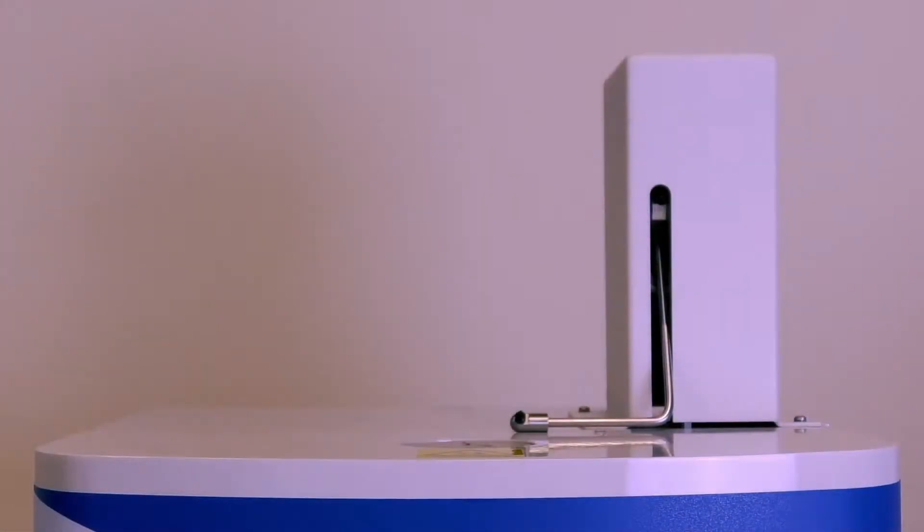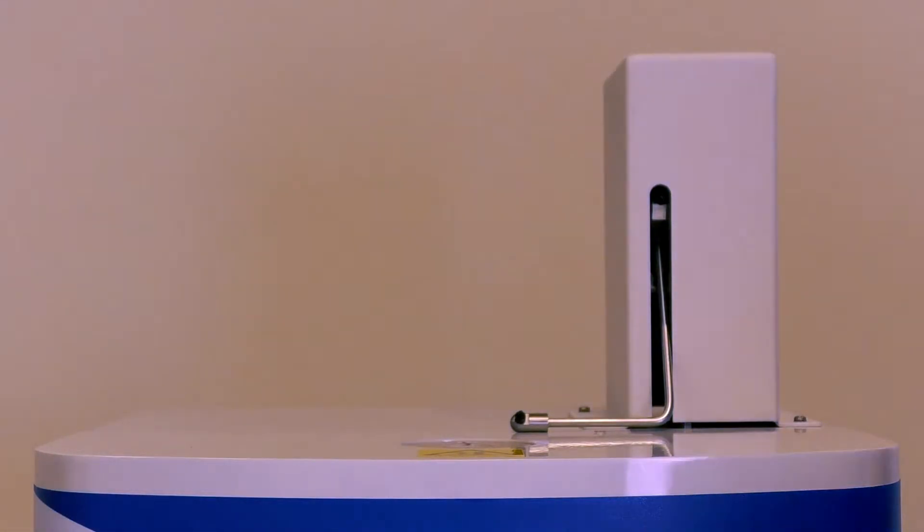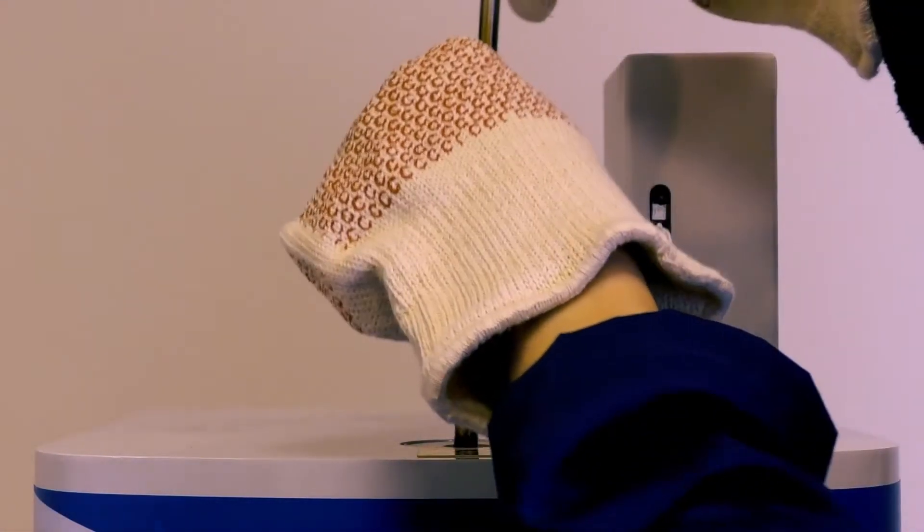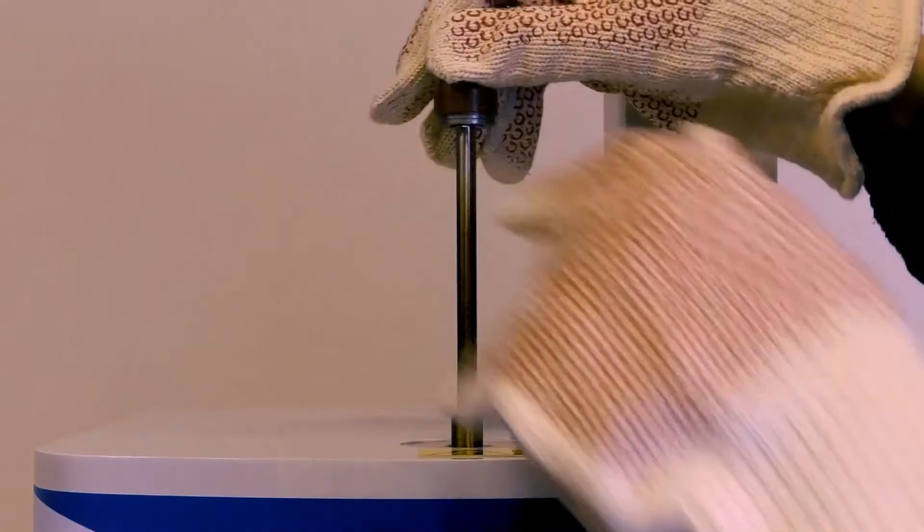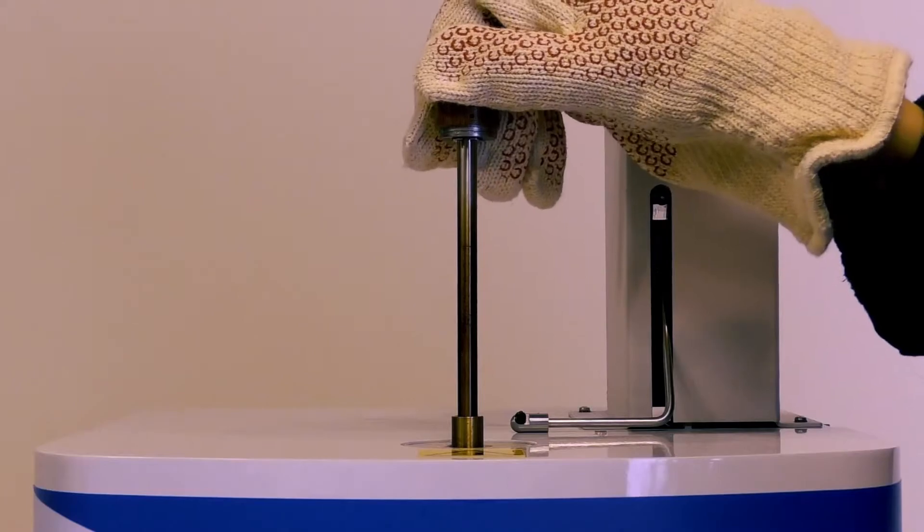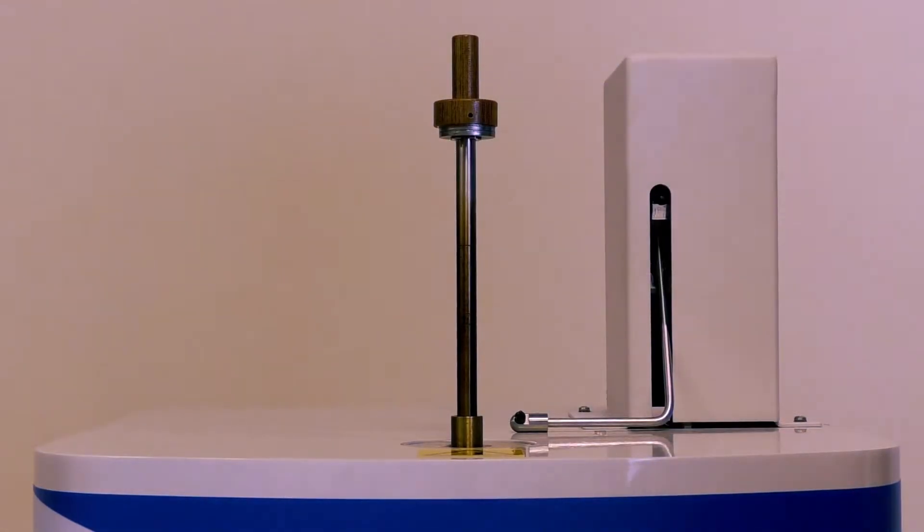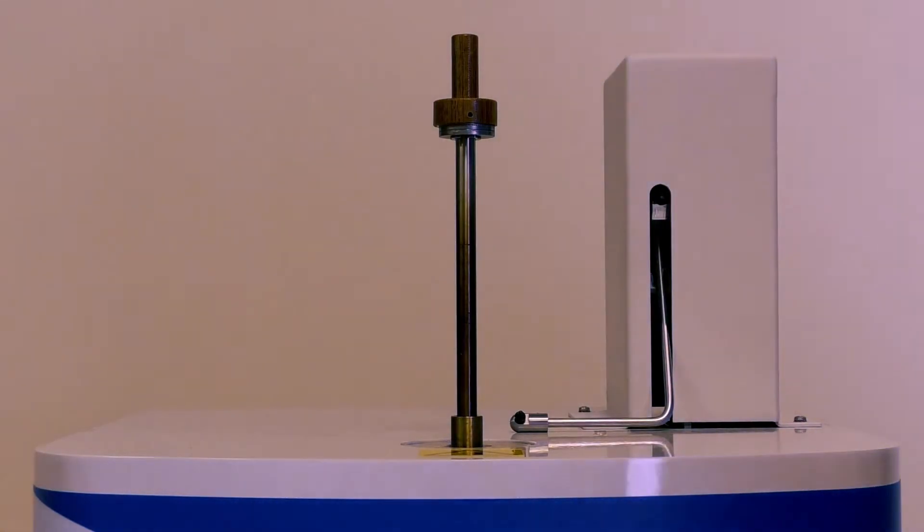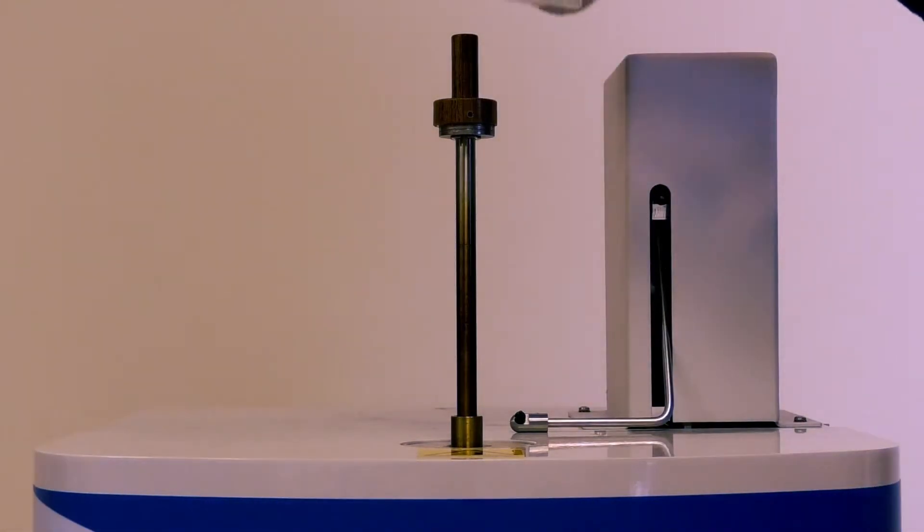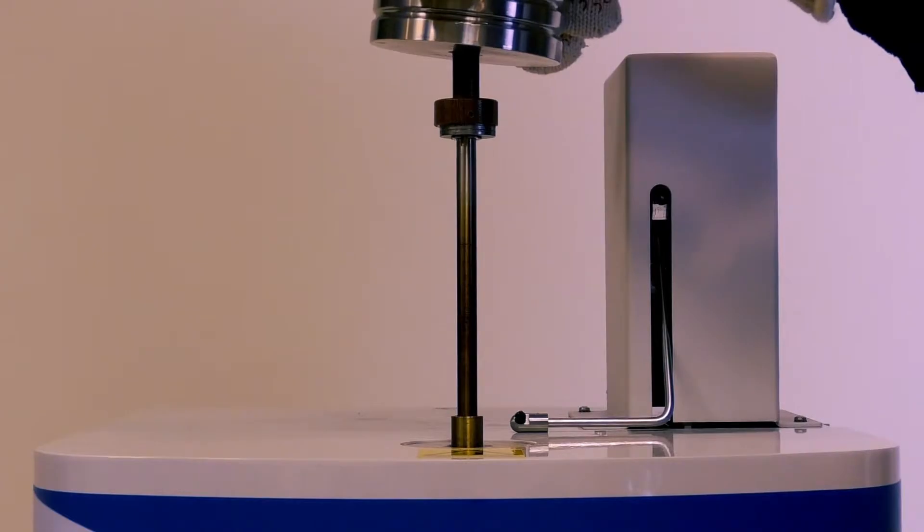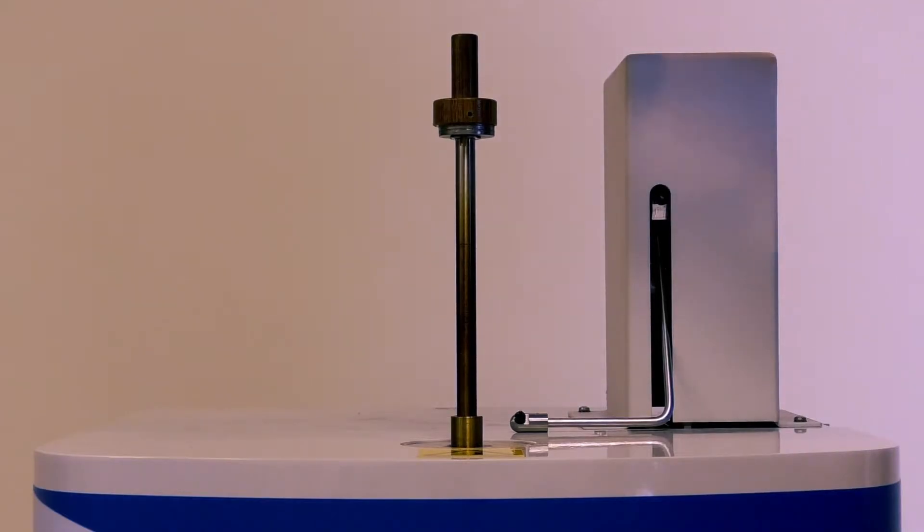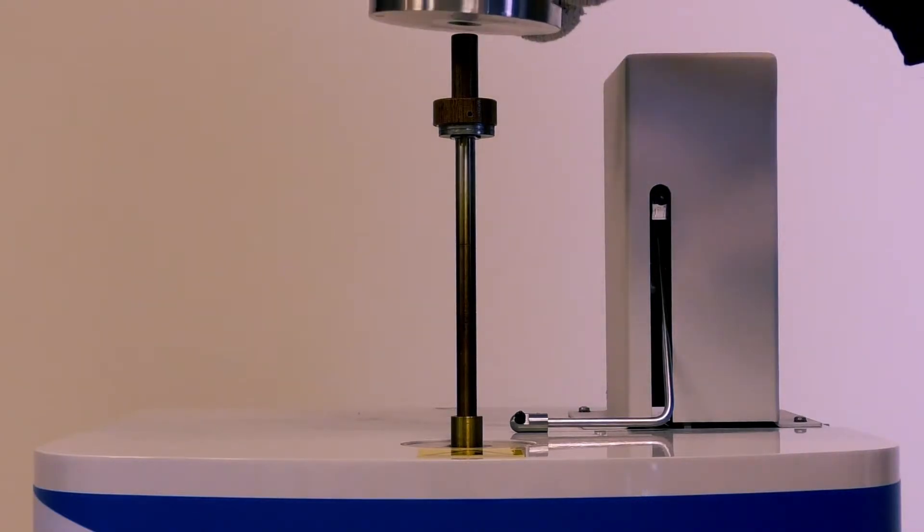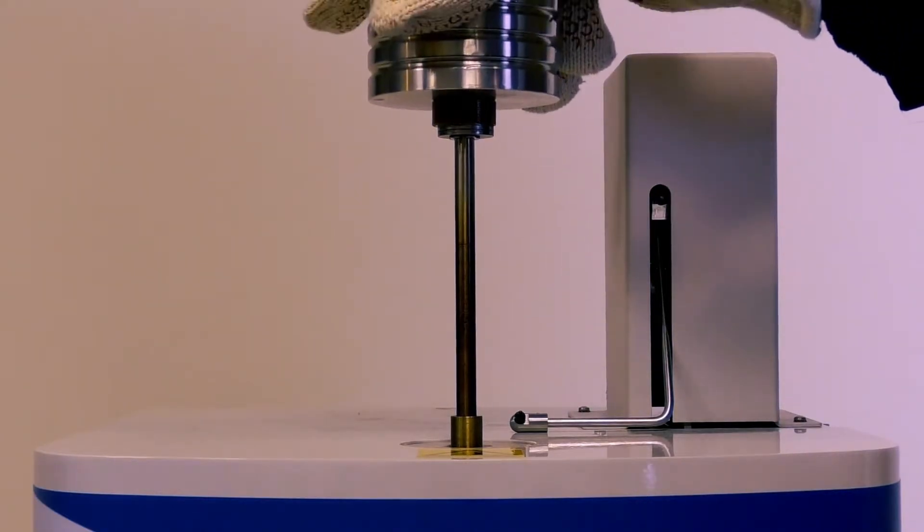The piston is inserted into the barrel and weight is set on top of the piston insulator. The piston will exert pressure on our polymer during the test. The weight load is selected from either the table of the ASTM standard or the supplier specification sheet.